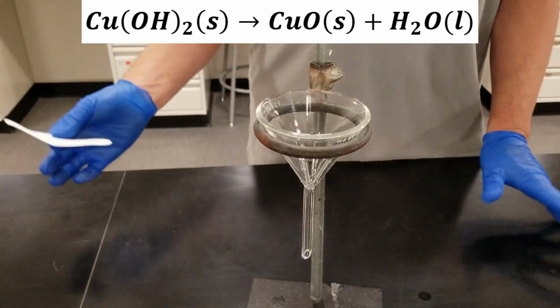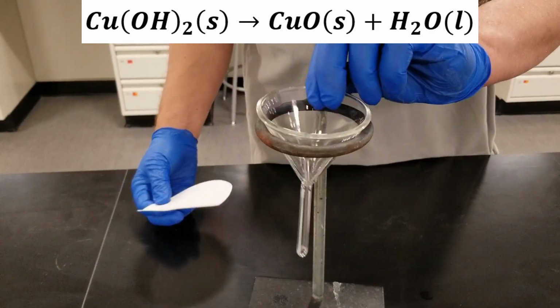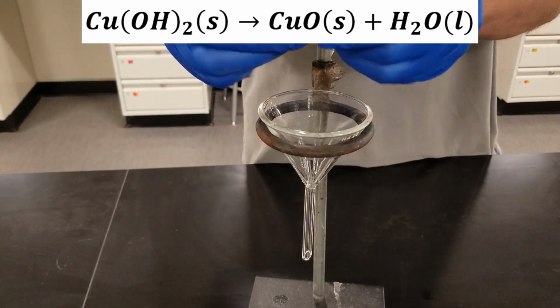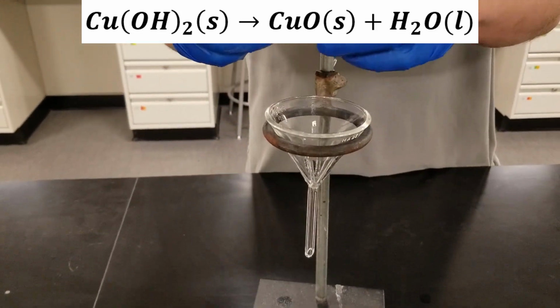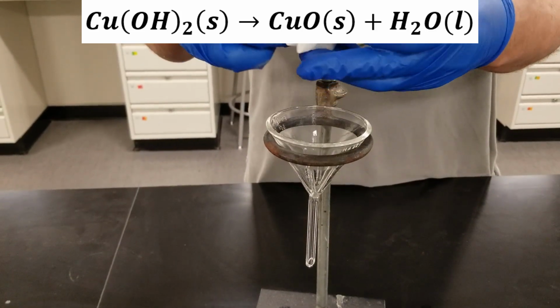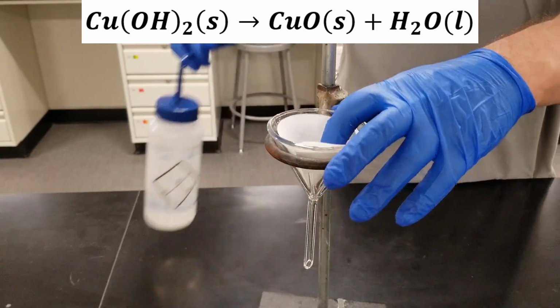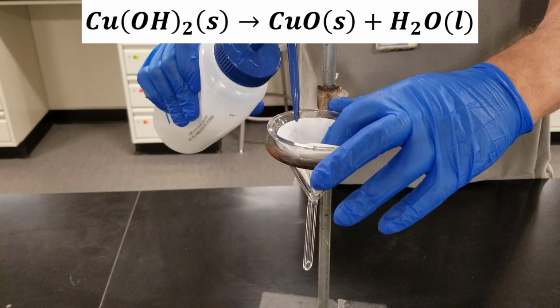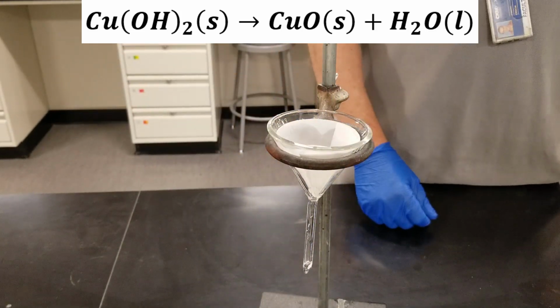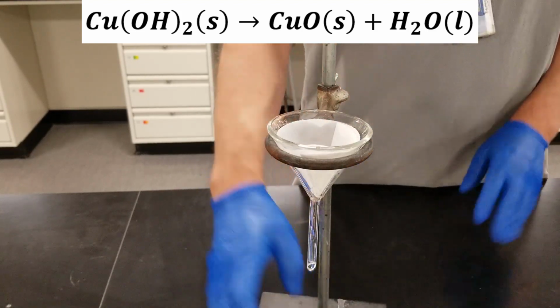Okay, that copper oxide, we want to isolate it. We're going to isolate it by gravity filtration. Got a big sheet of filter paper, and the way this works, you fold it twice, give yourself a little cone, get the little edge there, pop it in, get it wet so it stays put, and there's our filter cone ready to roll. Help if I put a beaker under it.